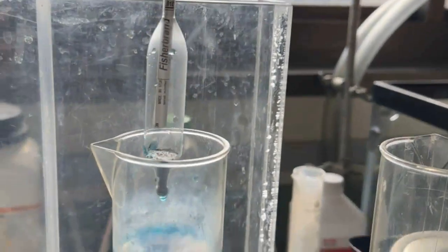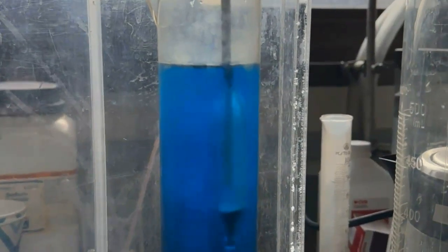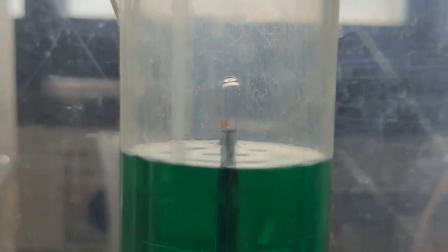So generally what happens when you drop them into water, they kind of plop upwards. And sorry that this graduated cylinder is a little bit foggy. It's probably from the cold water. But just to kind of show where it is coming up to, it's right below that darker line. So it's less dense than 1.0, whereas the green water is right at 1.0, which is what we would expect for fresh water, just straight up room temperature fresh water.